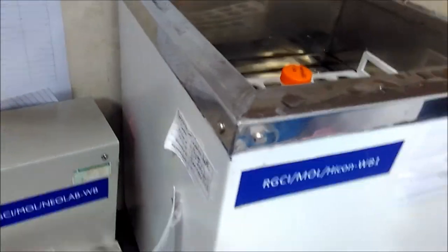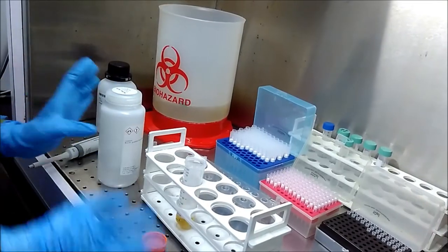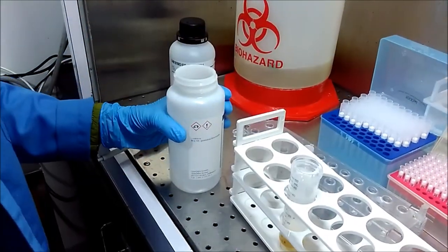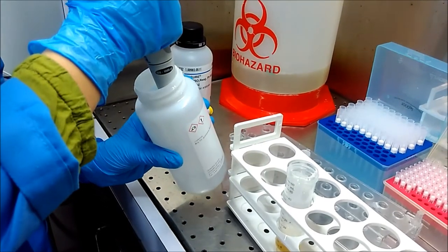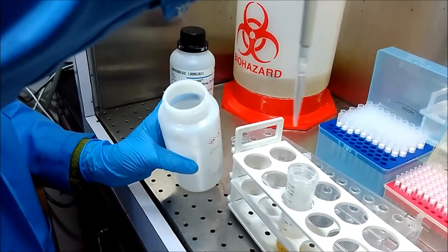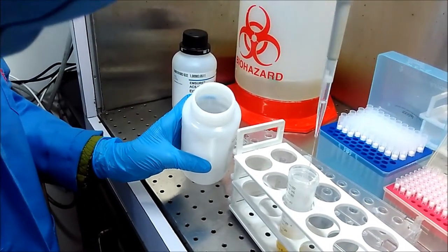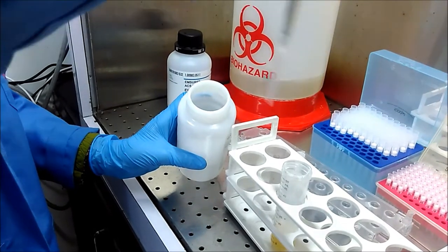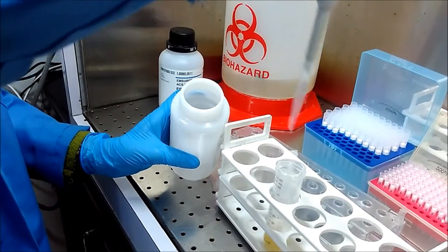As you can see in the water bath, the temperature reads about 60.8 degrees — more or less 60 degrees. After half an hour, I am going to add ACB buffer to the lysate we have prepared. I am going to add 9 ml of ACB buffer.